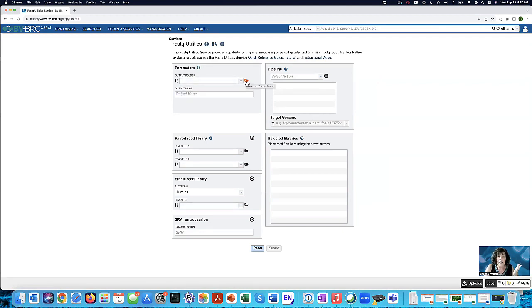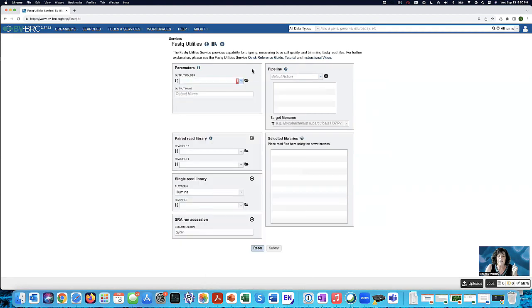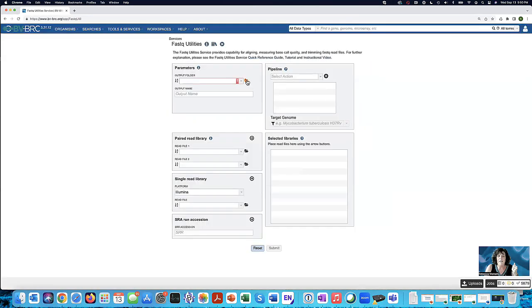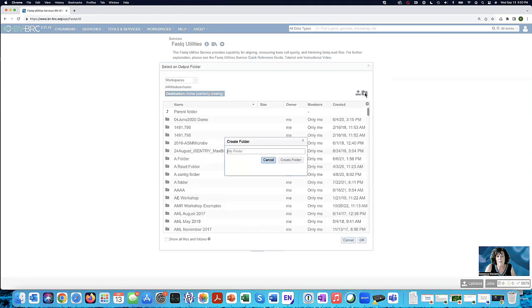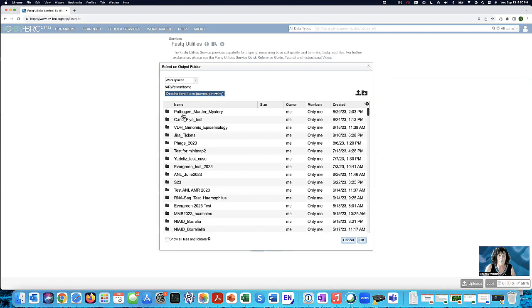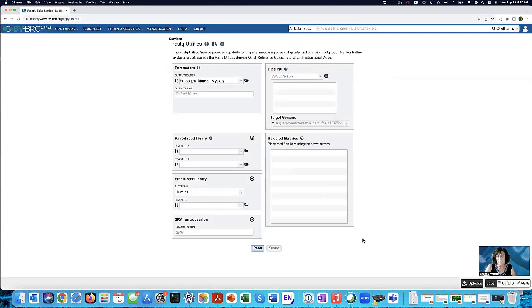If I wanted to create a folder to do this, if I click on the down arrow, I can see folders that I've created recently. But if I want to go to my workspace, when I click, let me show you again, when I click on this folder, it's going to open up a dialog box with my workspace. And I could create a folder here by doing something like this, or I could upload data here, but I've already created this folder. So I want to go to the one I created called Pathogen Murder Mystery. And if I want to just save it there, I would click OK. So it's going to save it in that folder. I could have used one of those subfolders.